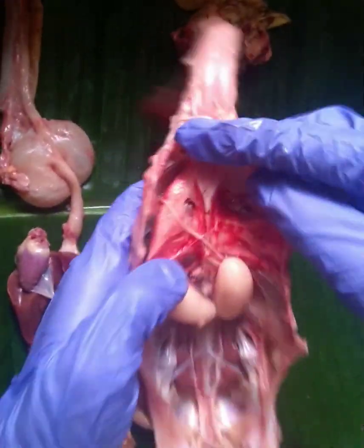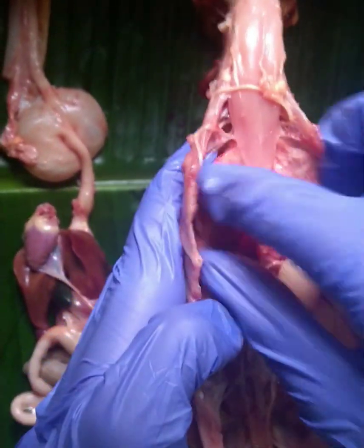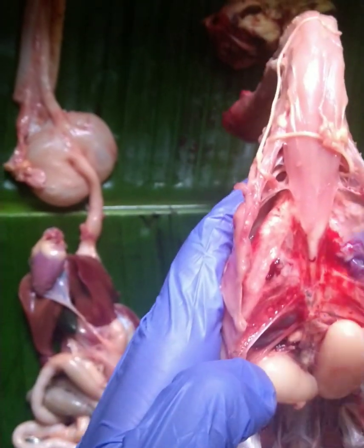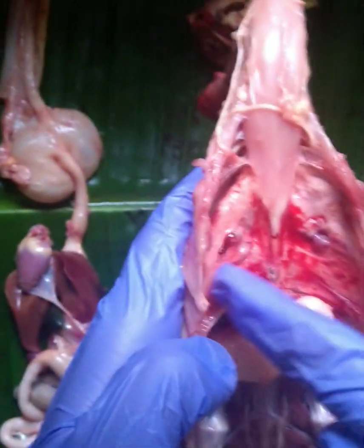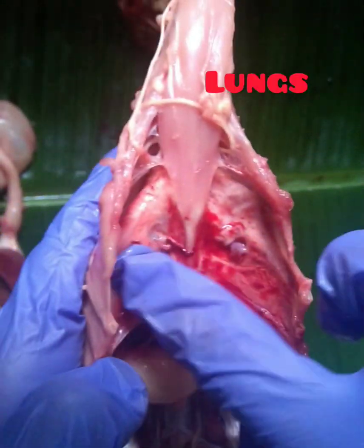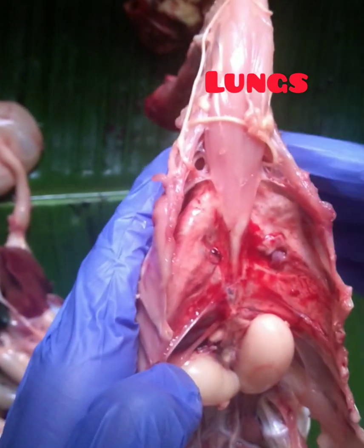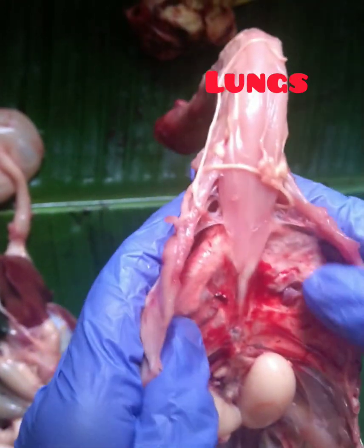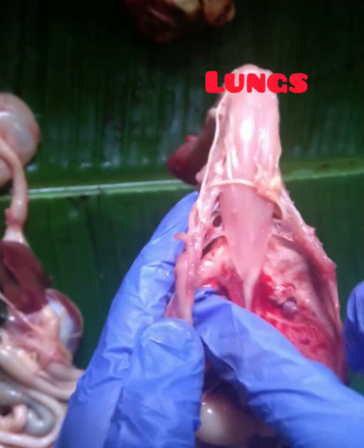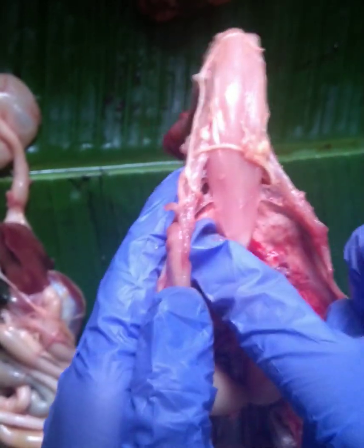It later flows through the air sacs, which transport the air into the lungs. As you can see here, the lungs are light pinkish in color, spongy in appearance, and you can hear crepitating sounds when you press them.